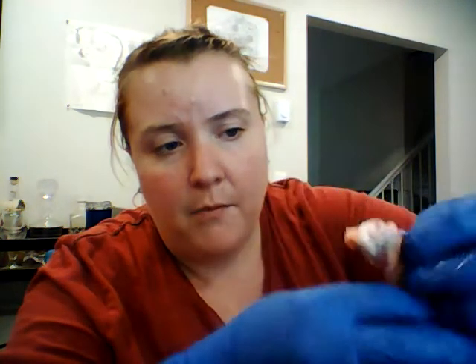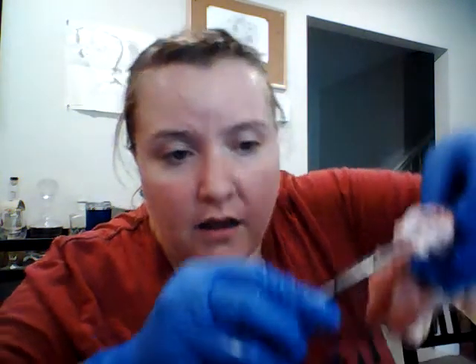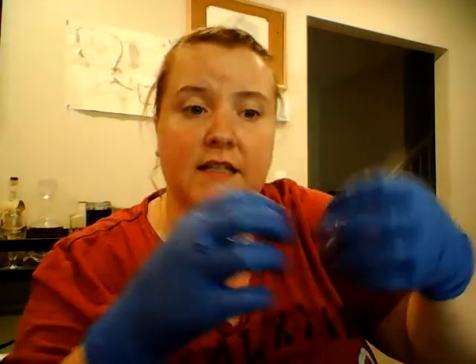And then the way that the rheumatoid arthritis would work is that it would inflame that synovial membrane on the outside, the one that I showed you that's deep in here. That synovial membrane right there would be inflamed, and it causes it to be difficult for people to clench their fists and things like that, because it causes all that swelling of the joints.